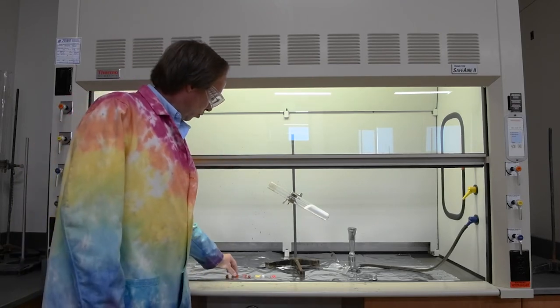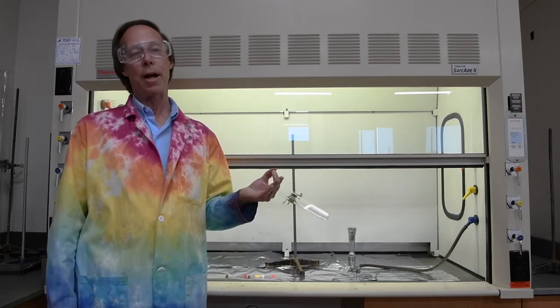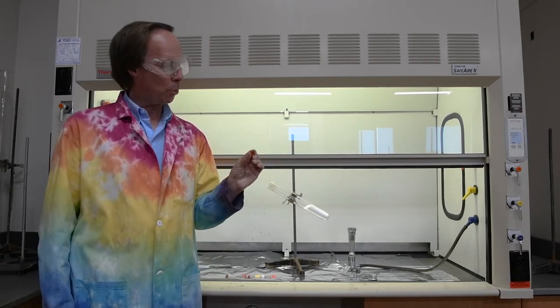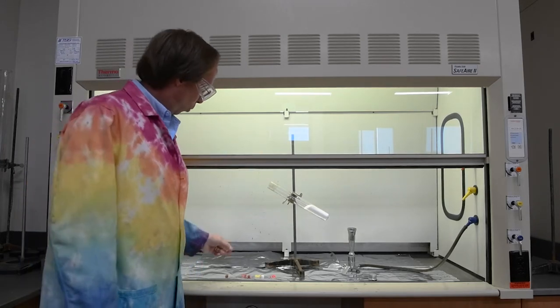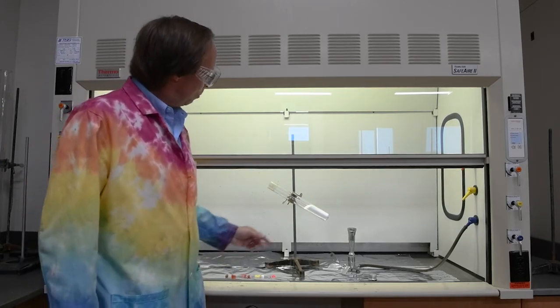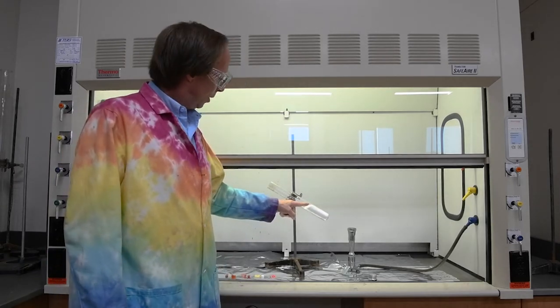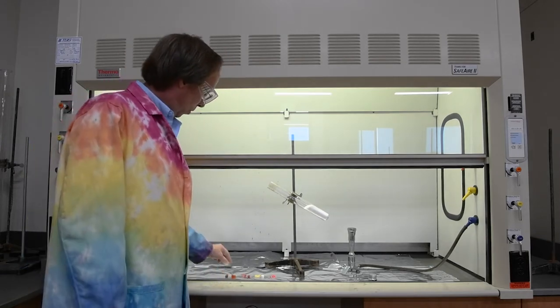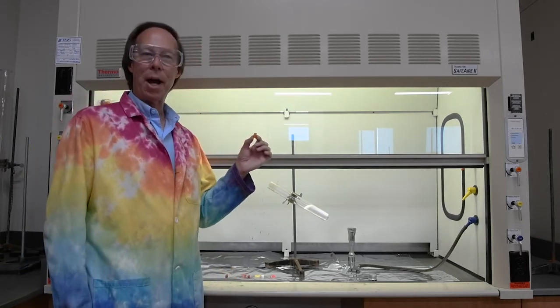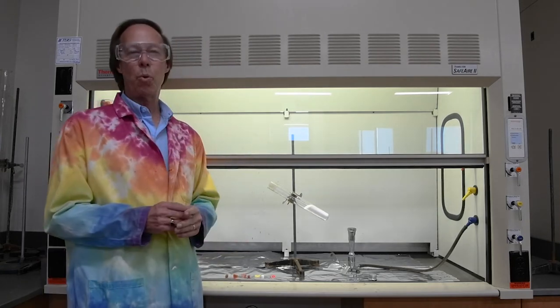In order to release the energy in a food item, you need oxygen. That's why we breathe oxygen. The oxygen is combined with the food and essentially is burning it in your cells. We're going to do that directly by using potassium chlorate. So potassium chlorate is a good source of oxygen, and combine that with the carbon and hydrogen in these food items as our fuel, we can release that energy fairly quickly.